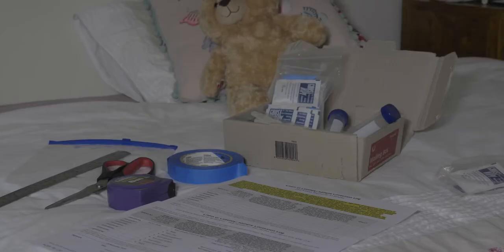In this video, I'm going to demonstrate how to take a dust sample for lead. This is generally conducted in those parts of the house where children and indoor pets spend time. Before you start, you need to make sure you've got everything ready to go.